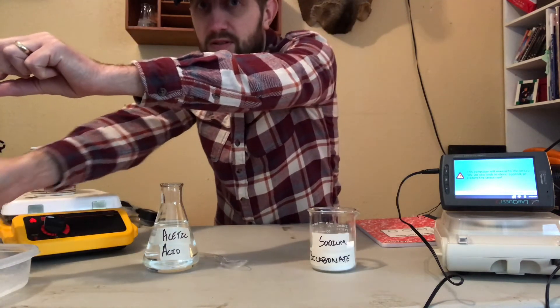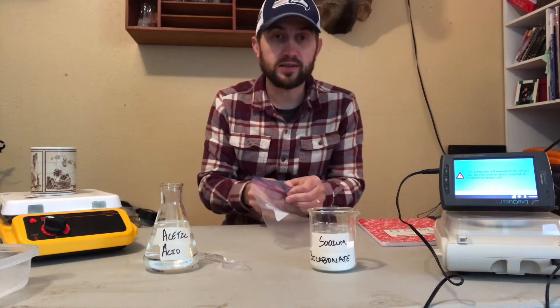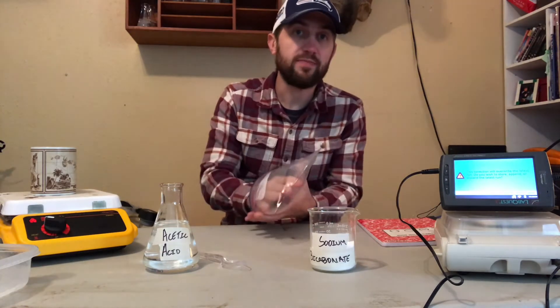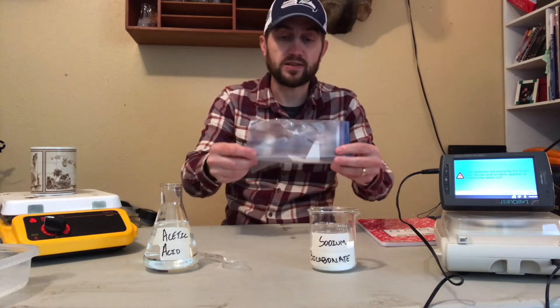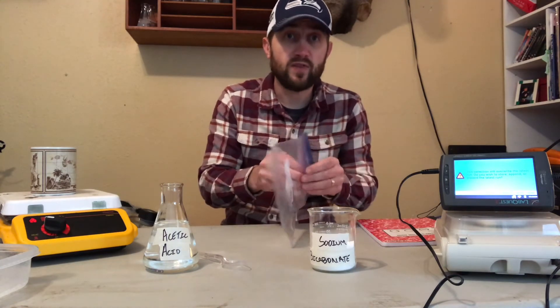Another way to look at this, to show the gas being formed besides just the bubbles — I have my coffee here on the hot plate staying warm — is what's called an airbag lab, which we typically talk about during a semester. An airbag in your car goes off because of a really fast chemical reaction that puts off an enormous amount of gas in a quick amount of time.